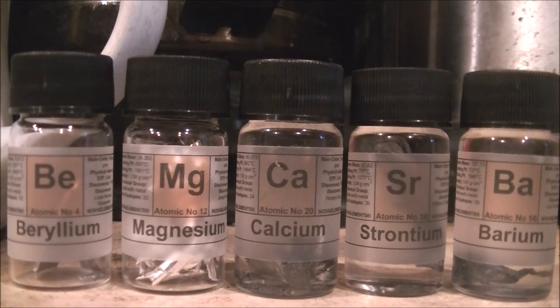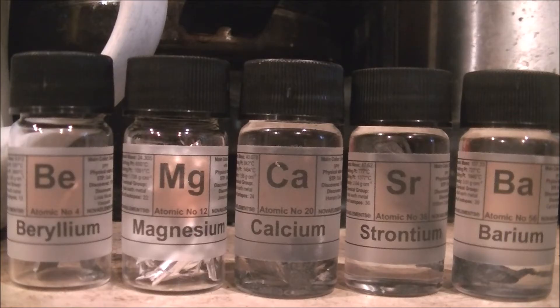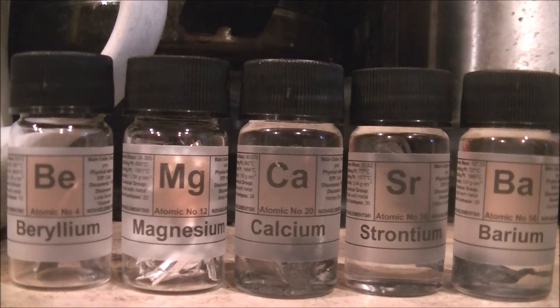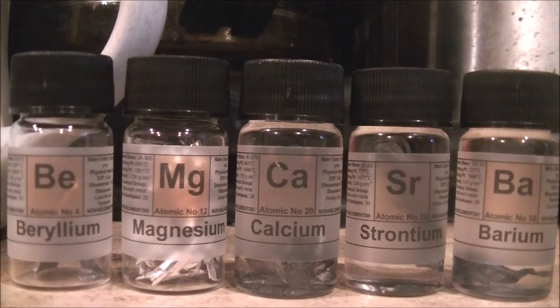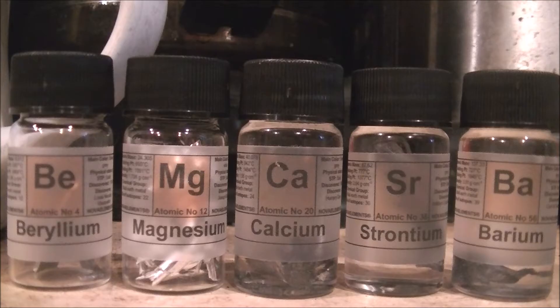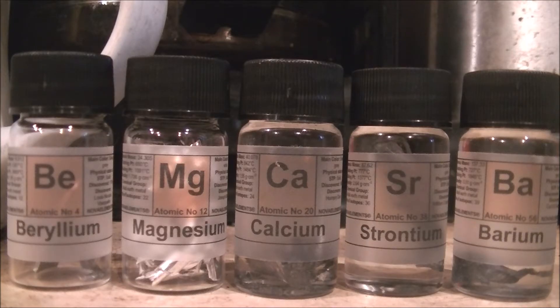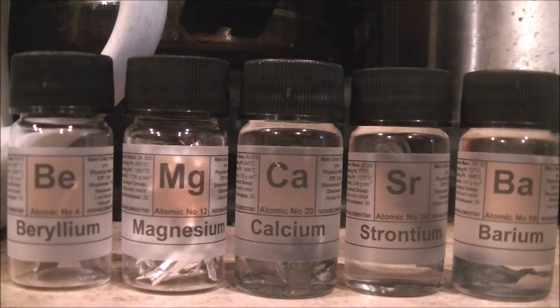I was able to get five out of the six, but I couldn't get radium for obvious reasons. I'm going to drop each of these in water to show you what they do.